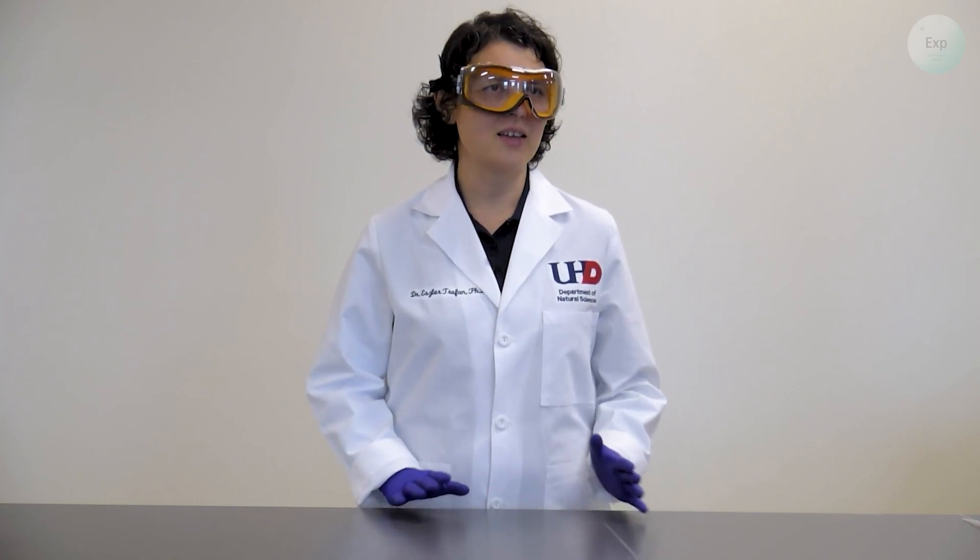Hello, my name is Dr. Esther Trofan, and in this video, I'm going to demonstrate how to collect the mass and volume information that we need to determine the density of our sugar water solutions.